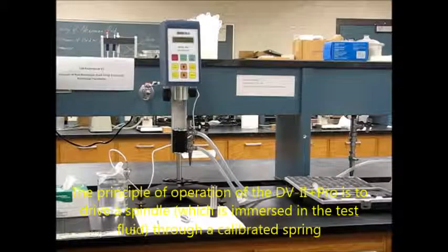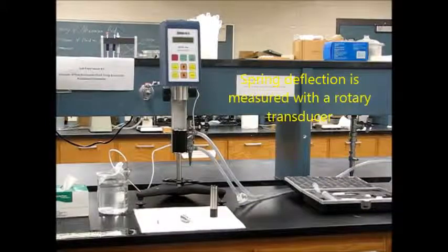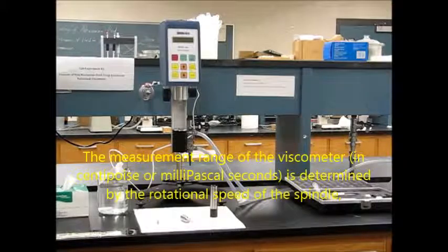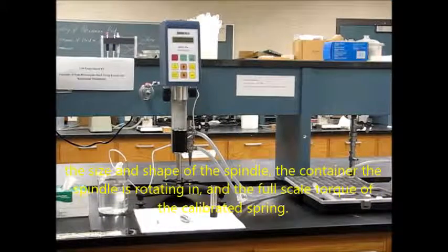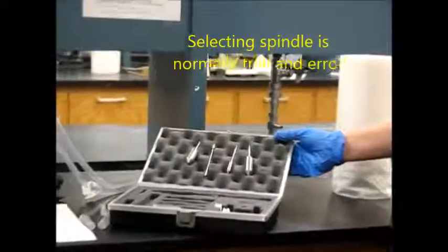The principle of operation of this viscometer is to drive a spindle through a calibrated spring. The viscous drag of the fluid against the spindle is measured by the spring deflection. Spring deflection is measured with a rotary transducer. The measurement range of the viscometer in centipoise, or millipascal seconds, is determined by the rotational speed of the spindle, the size and shape of the spindle, the container the spindle is rotating in, and the full-scale torque of the calibrated spring. Selecting a spindle is a trial and error process.